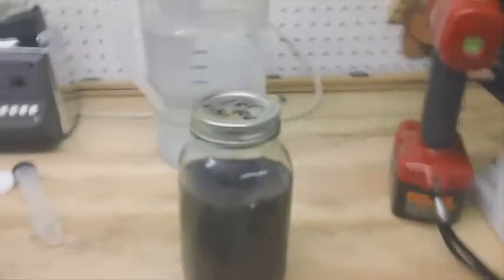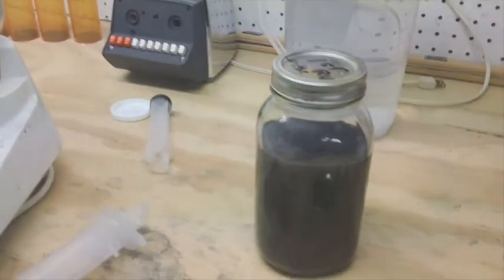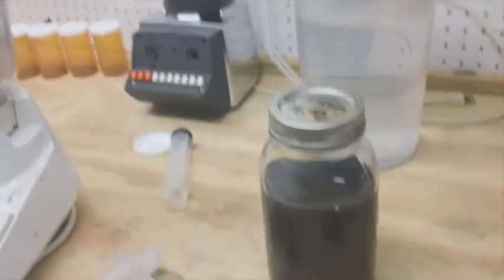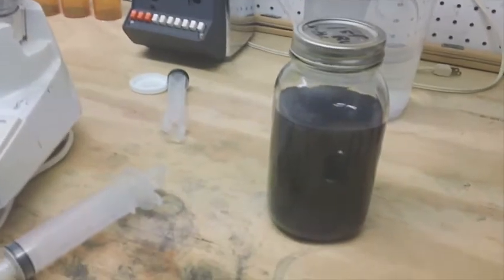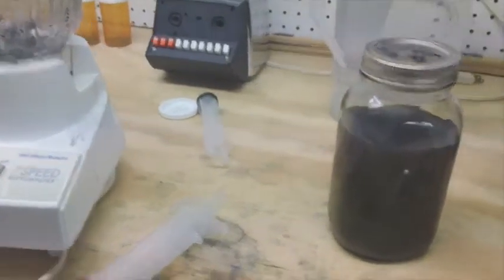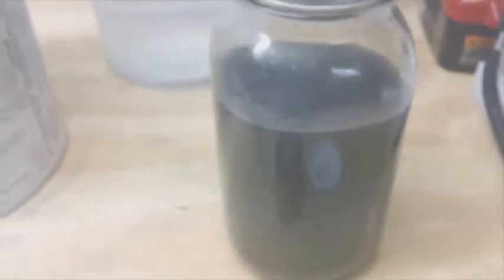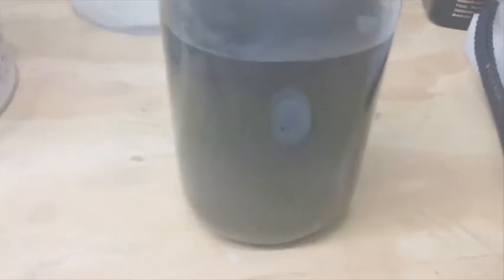I don't know if leaving the graphite at 40 grams will matter, but the next experiment I'm going to try that. I'll be posting videos on this process as I go along. This is the first run — one liter mixed according to his video. It has to settle out. There are some other separation methods I want to explore, but I want to see how much graphene was created with this method first. Check for new videos — I plan on producing the graphene, cleaning and drying, and showing the whole procedure from start to finish. This is Technomancer for Zero Point Fuel, signing out. Thank you.